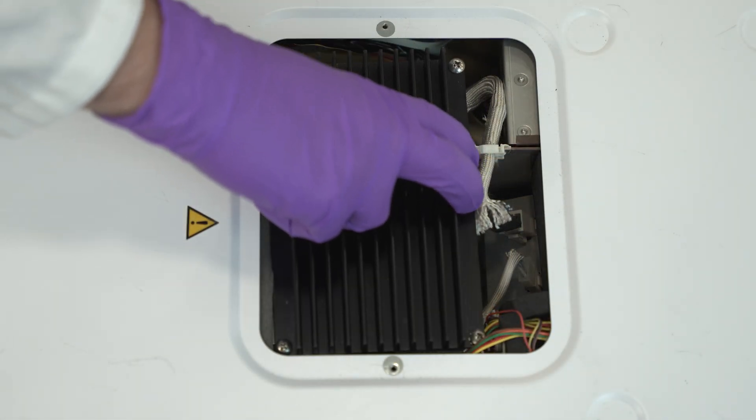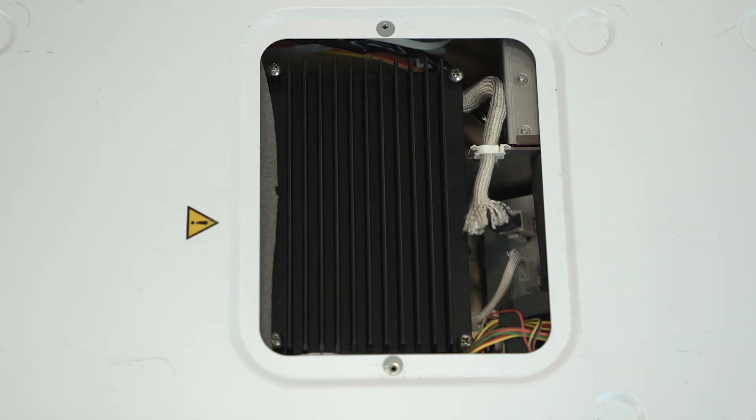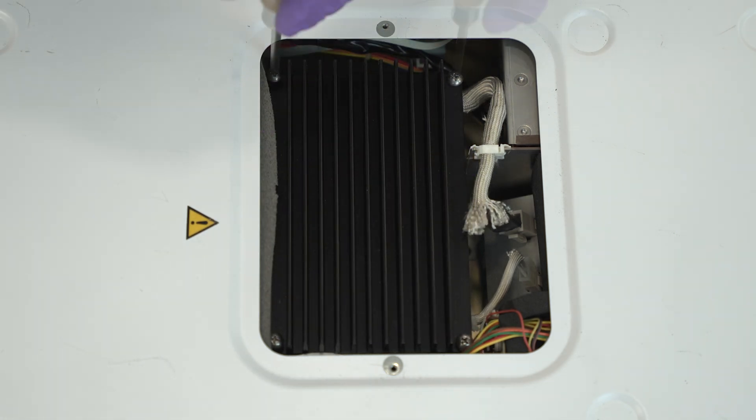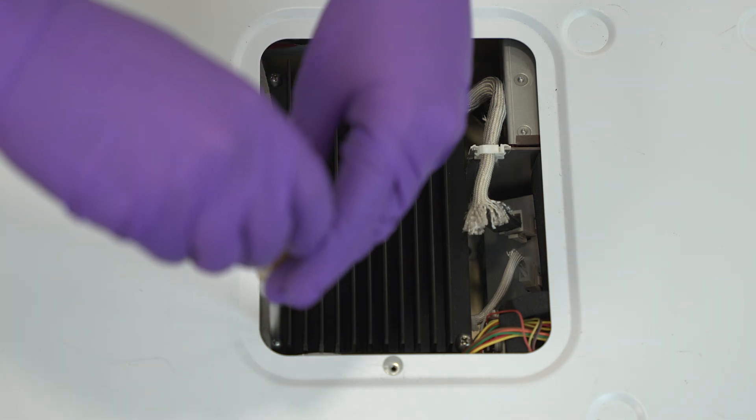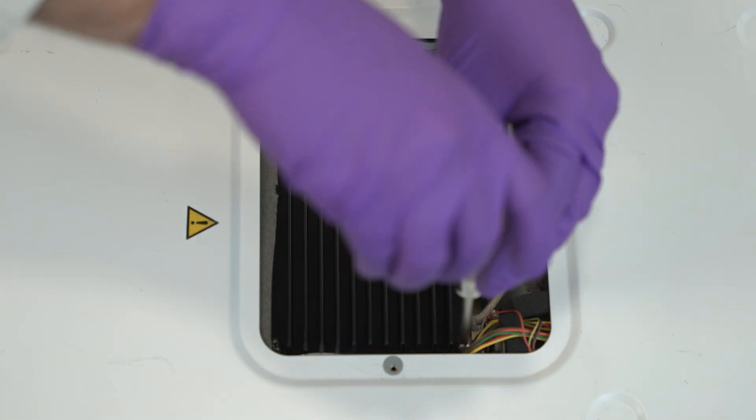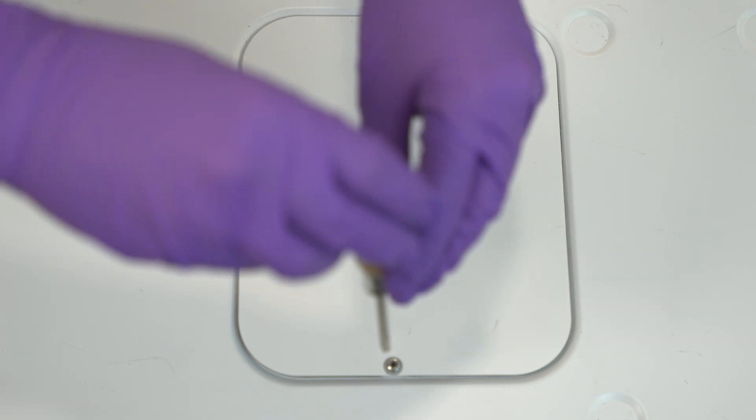Securely tighten the radiating fin assembly over the optical chamber. Securely attach the top cover in the correct orientation by aligning it with the hollow of the instrument to prevent UV light from escaping. Replace any reservoir trays or modules that were removed to access the top cover of the UV-Vis detector.